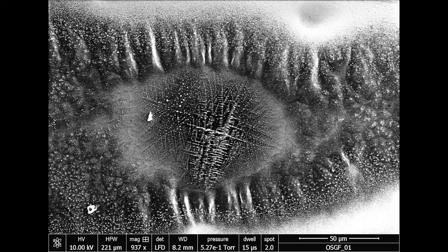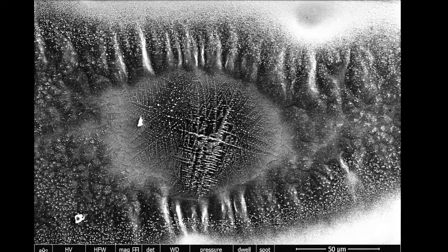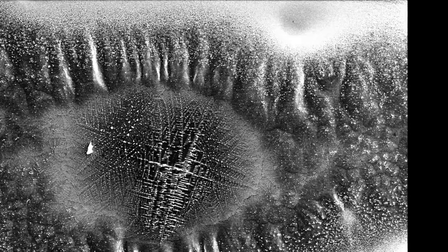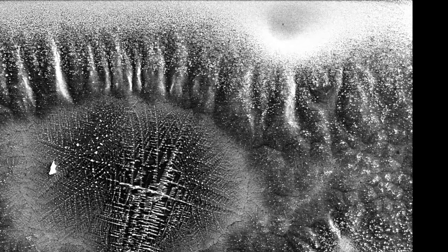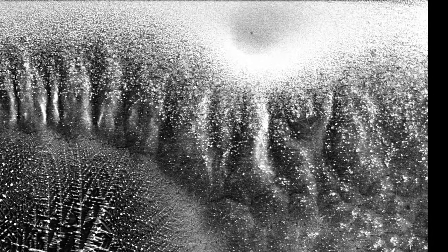In this image, that's exactly what we're looking at. We're looking at an oil spot droplet in the center, and then on the outside, we've got these blown out, washed out white areas. If you've got really good conductivity, you'll get a really good high contrast image. If you're dealing with something like glass or pure silica, you don't have a lot, so that's why the outside of the image is washed out like that.